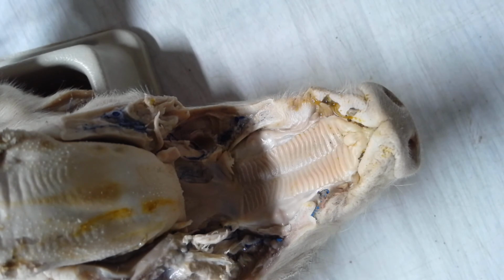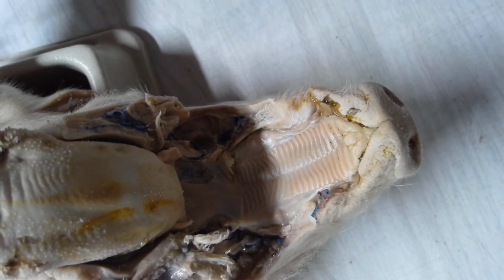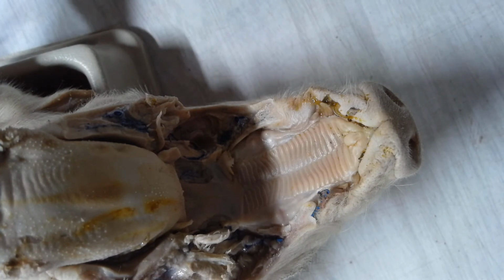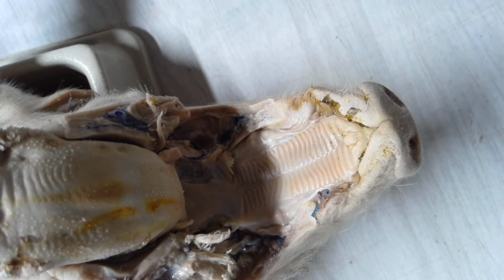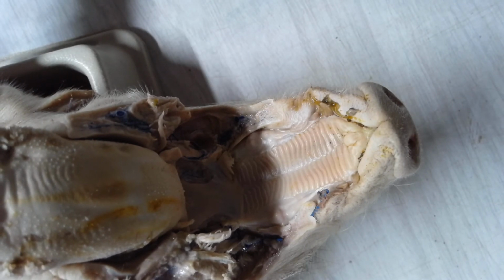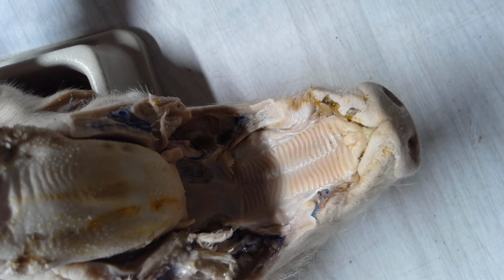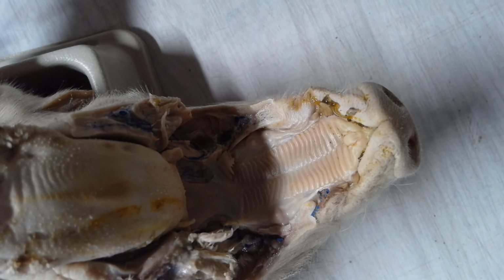Alright, so I'm going to take my time pointing out some of these structures. I'm going to be following a list there. I'm not going to be focusing on external structures. I think that would be pretty much cut and dry on external features. I'll be concentrating mostly on internal organs. And I will not be having any reproductive organs on the lab exam, so I will not be spending any time going over those as well.